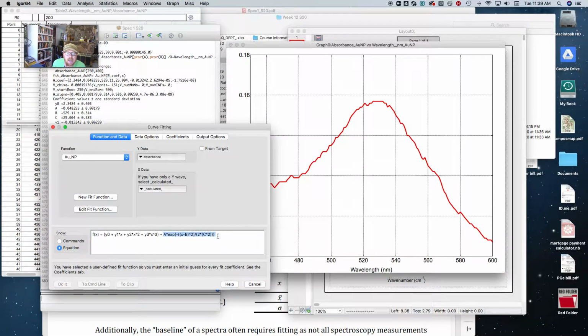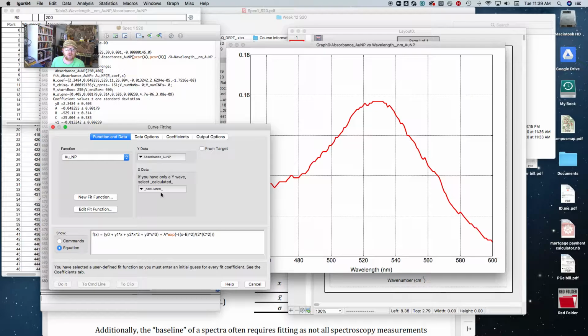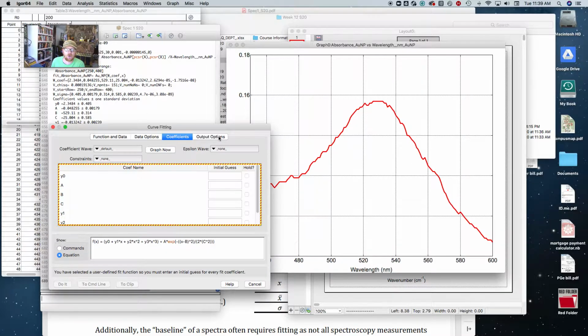So here is the Gaussian portion, and here's my baseline portion. And my baseline, I used a polynomial. So you can see there's x cubed plus x squared plus x plus some baseline. And I found that when I just did this equation directly, it didn't want to fit so well. And I'll show you that now.